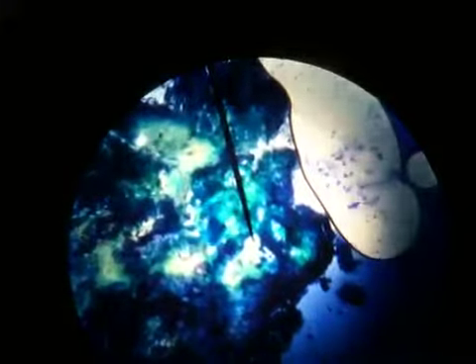Alright, now we can start to see some detail. So you can see what happens as I move the lens of the camera around a little bit. It's kind of hard to see the whole picture. But there we go. So the thing with the big glob on the right, that is an air bubble. And I can move the platform up and down and back and forth using the knobs on the platform, so I can move around and look for the details that I want to find. And so now I can use the fine adjustment to get it right where I want.